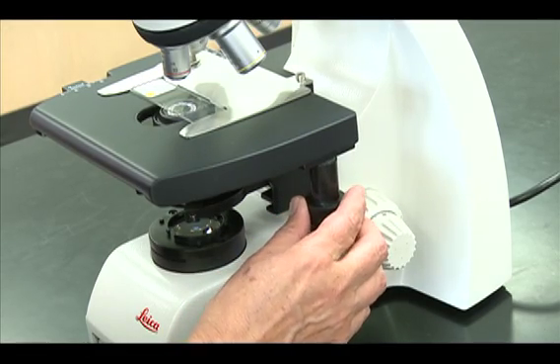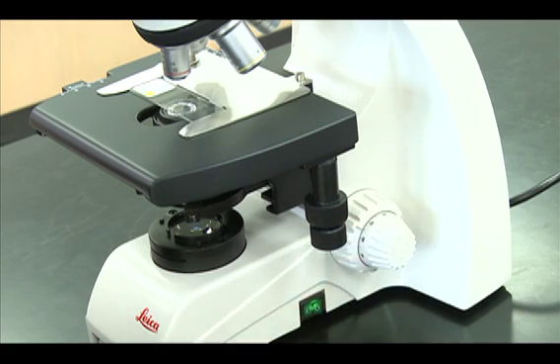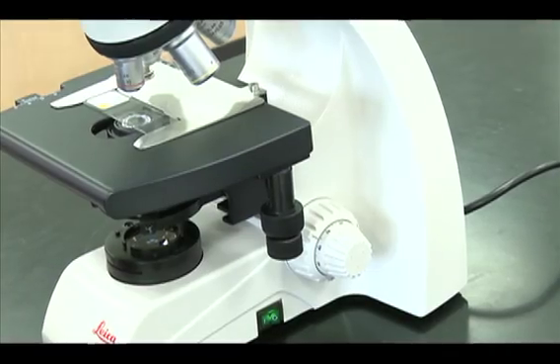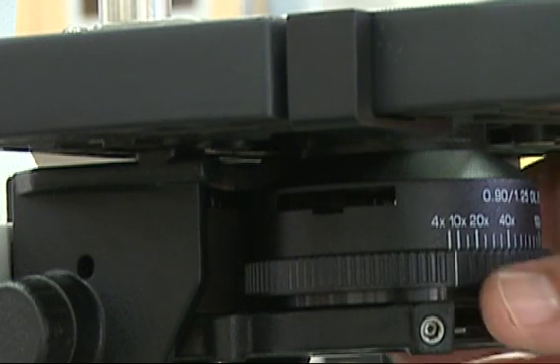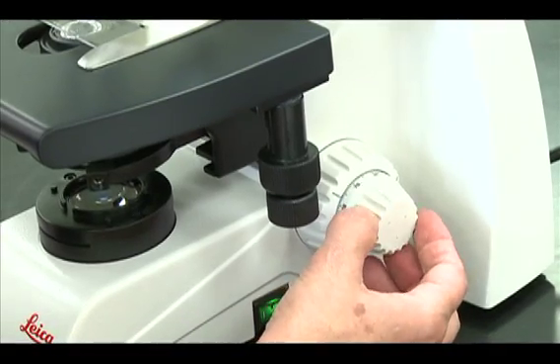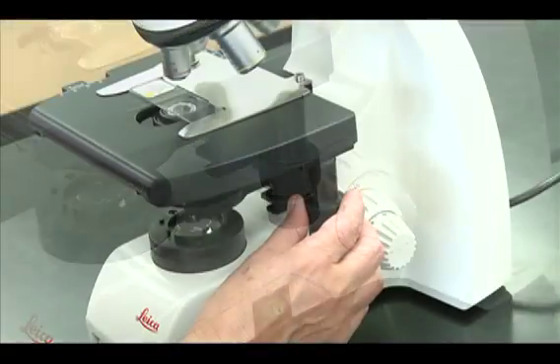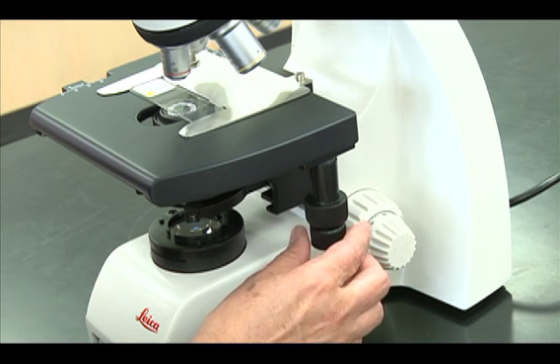Use the mechanical stage controls to scan your slide. Rotate the 10x objective into position and set the iris diaphragm ring to 10x. Focus with the fine adjustment knob only and scan your slide.